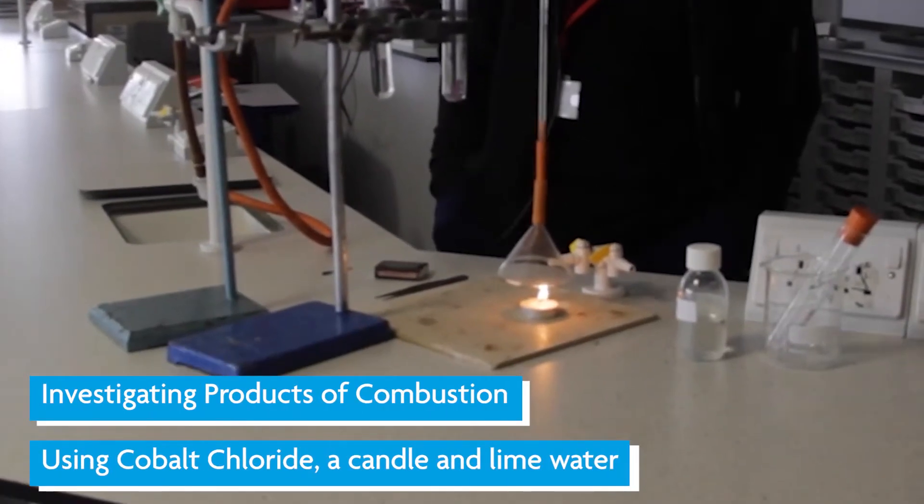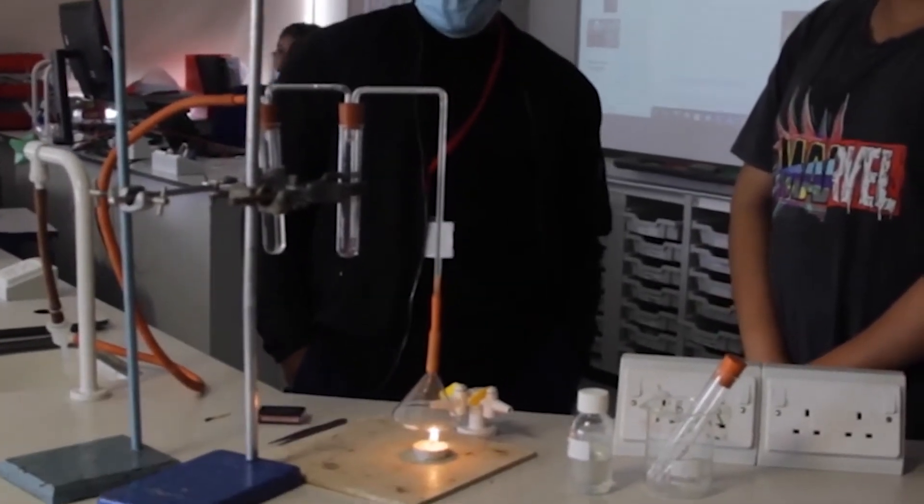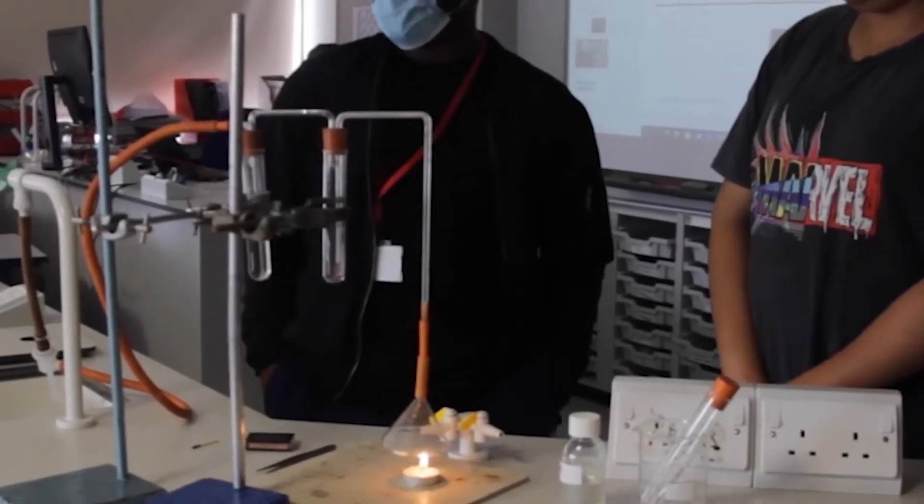So today we are going to be investigating the products of combustion using a candle, cobalt chloride and lime water.